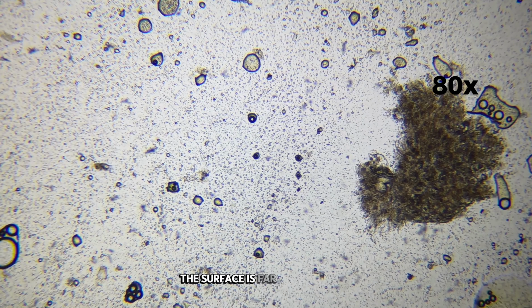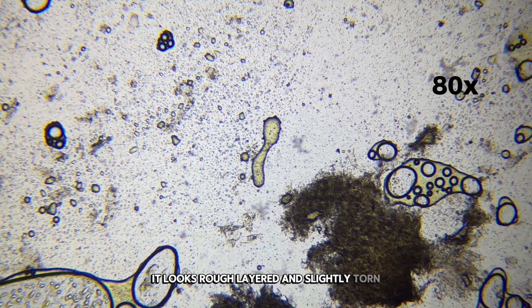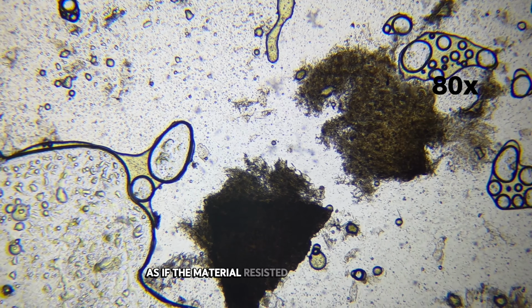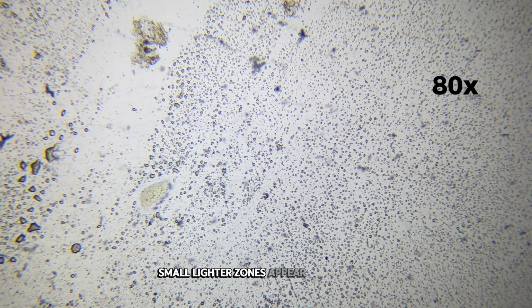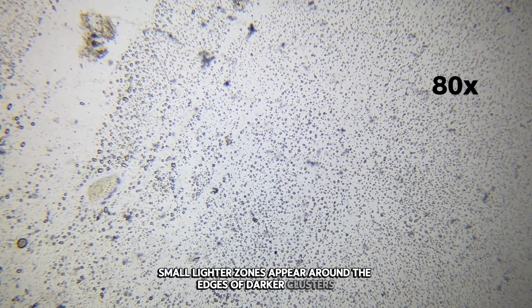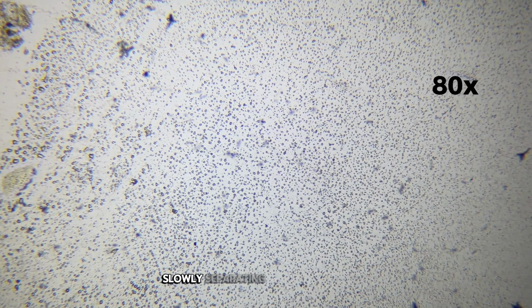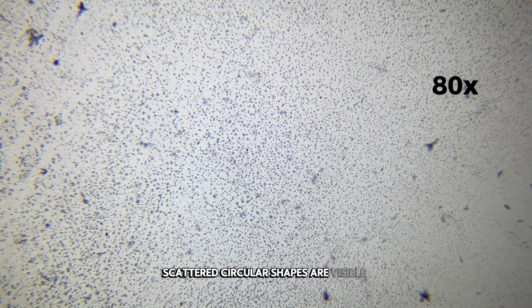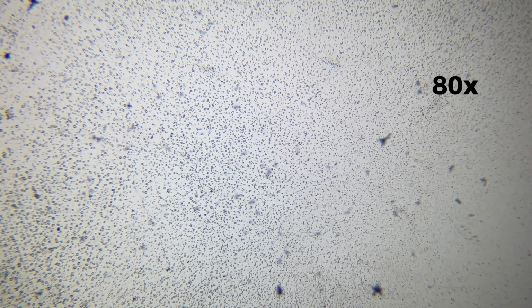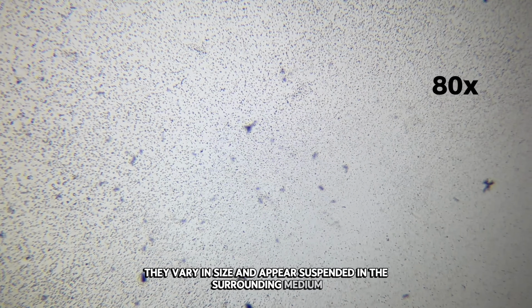The surface is far from smooth. It looks rough, layered, and slightly torn, as if the material resisted spreading during preparation. Small, lighter zones appear around the edges of darker clusters. These areas hint at moisture and oil slowly separating from denser tissue. Scattered circular shapes are visible throughout the background. They vary in size and appear suspended in the surrounding medium.